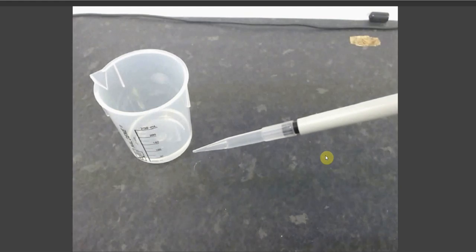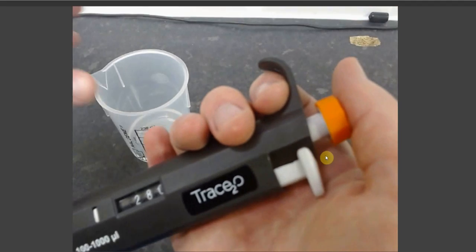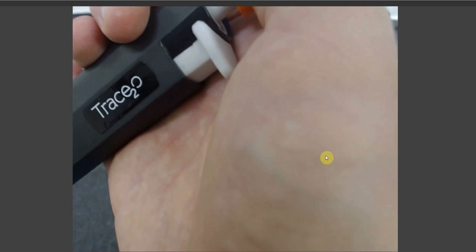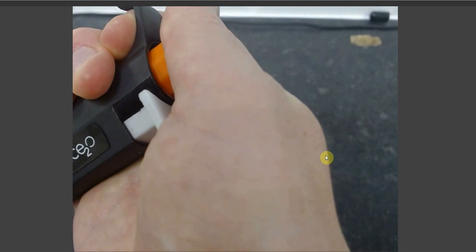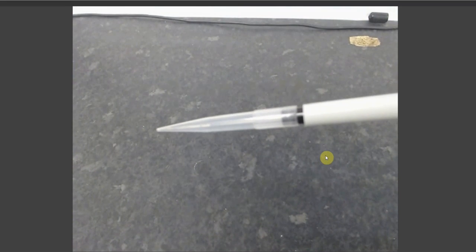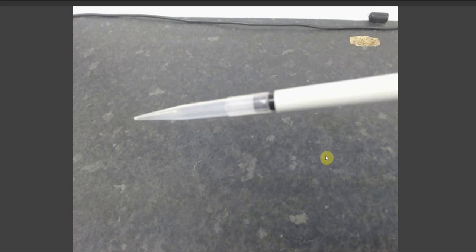To show you how to use the second stop, once again draw up the liquid you need using your first stop, and then you go down to dispense your liquid, go down to your first stop, and then press further until the plunger is fully depressed. This sends out a small cushion of air from the pipette, which empties the rest of the pipette tip and ensures the accuracy of your liquid dispenser.